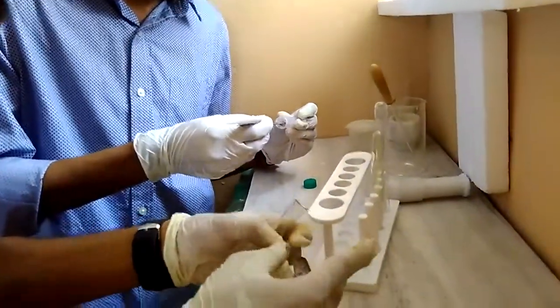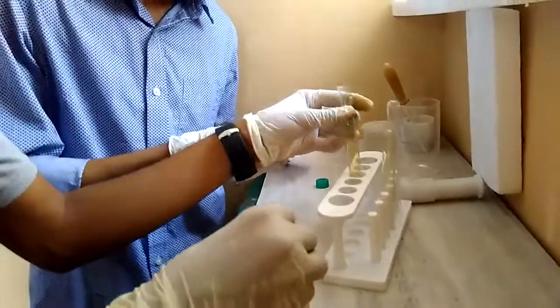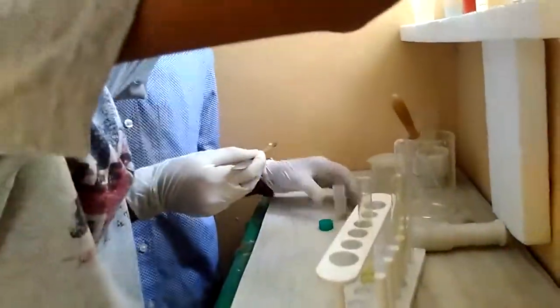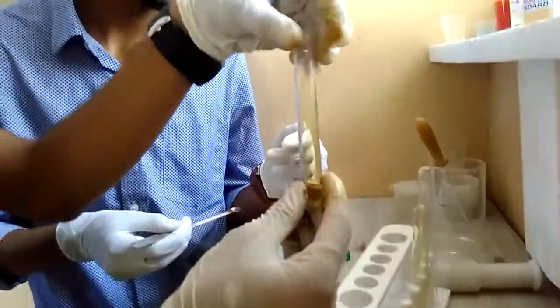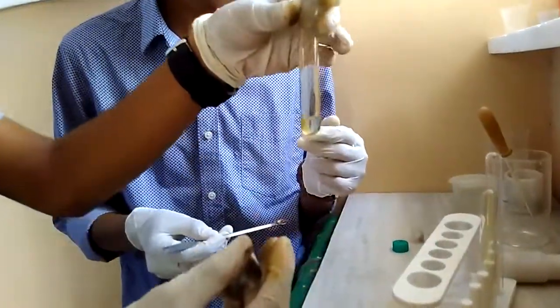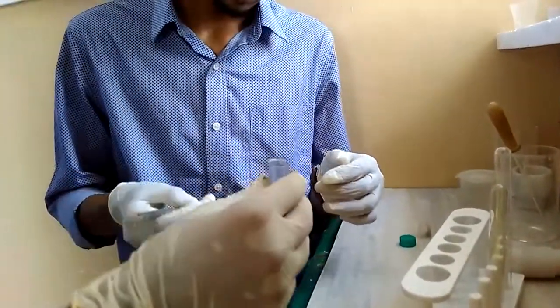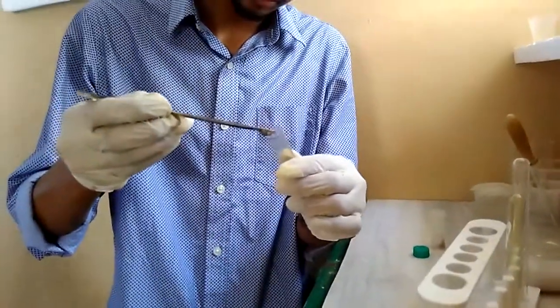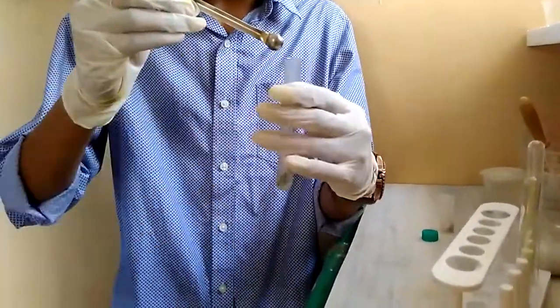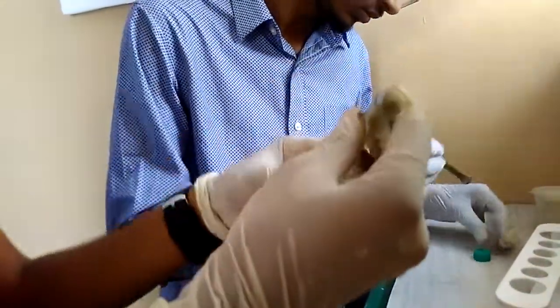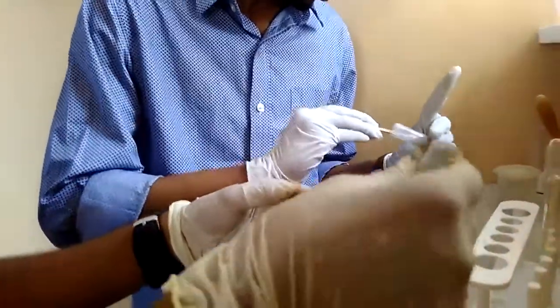Adin will be adding some copper. You can see that nitrogen dioxide has been produced already because nitric acid undergoes thermal decomposition. Adin will add some copper to it. You can see that the brown color has started enhancing.